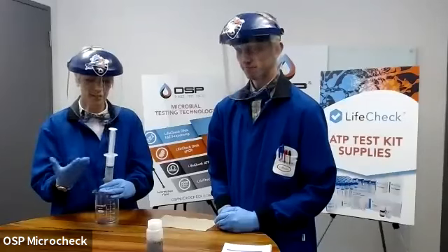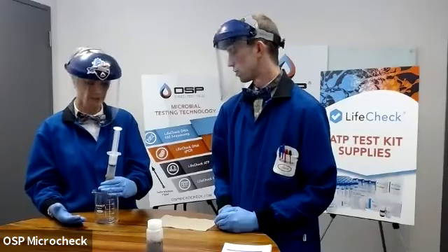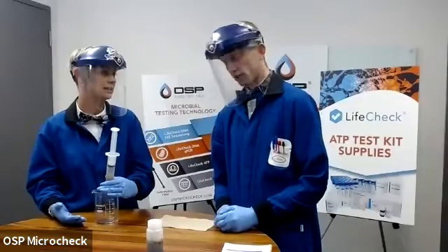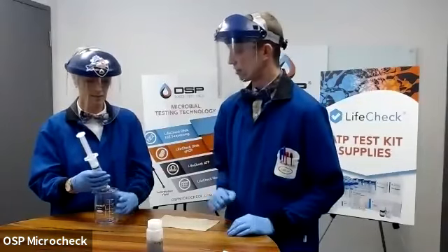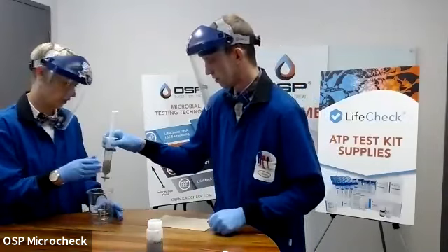Hands might hurt. But I'm going to say that I'm at the place where I can't push any more through, Mark. All right, what'd you get? 20 mil. 20 mils? Yeah. All right, the first thing we should do here is now record the volume that we did syringe. You want me to hold that for you? Sure.